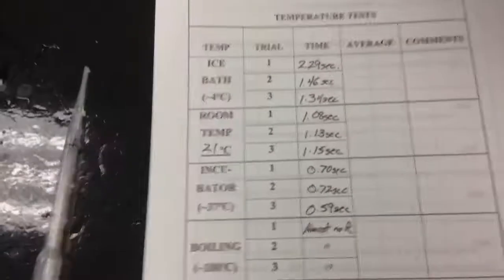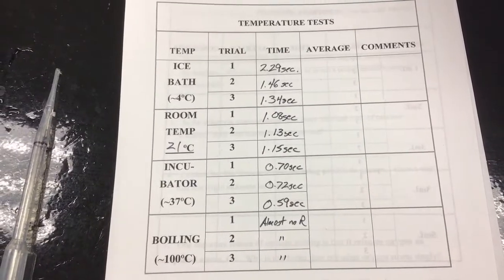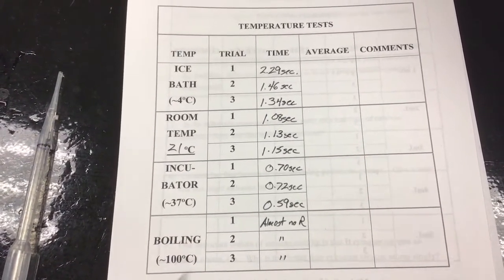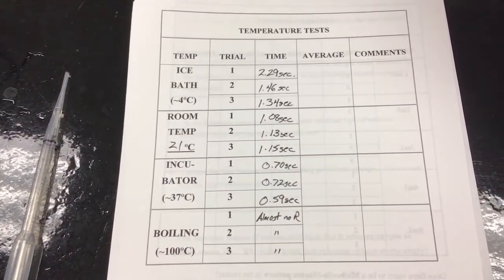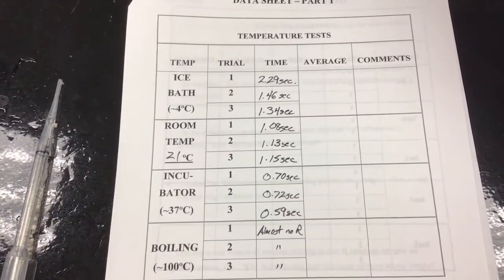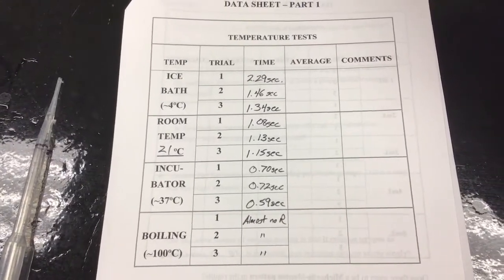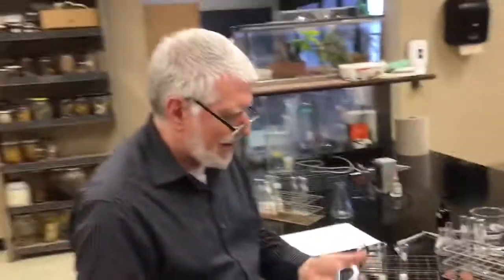So you made predictions about temperatures, do the averages. If you see something that you don't like, one of them seems to be a way off, you may decide not to count it in your averages. It's one of the sort of the thing that people make up their minds of when they do lab tests. Sometimes they go, oh, I squirted that too hard, or I didn't measure it right, or I don't think I stopped the clock right. But up to you.